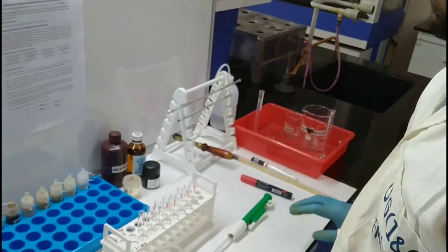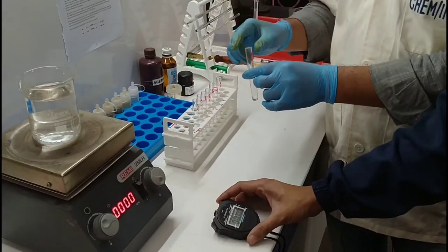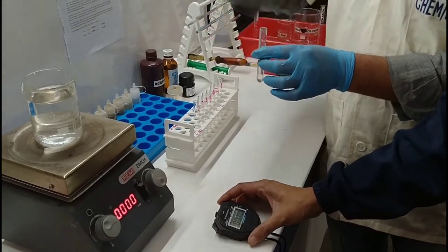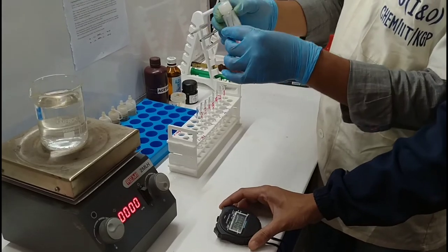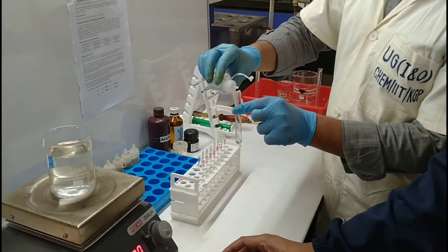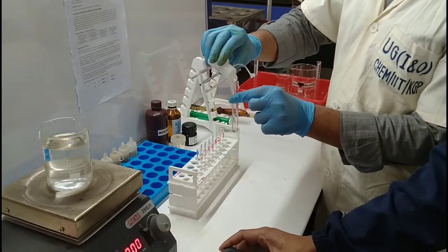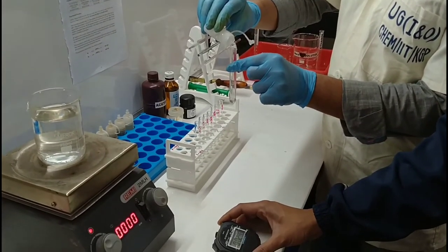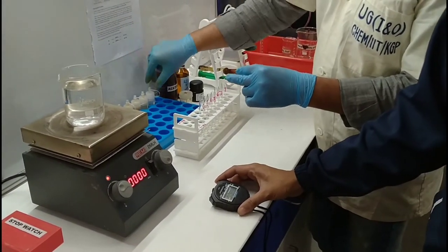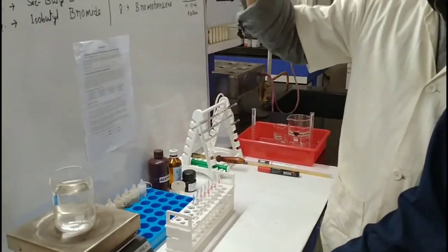We fill each test tube with 0.5 ml NaI. For the first test tube, we have to pour the 1st halide — I am going to add 5 drops of N-butyl chloride inside the test tube. Immediately, we have to start the stopwatch. I have already added 5 drops. Now we have to check whether precipitation comes or not.